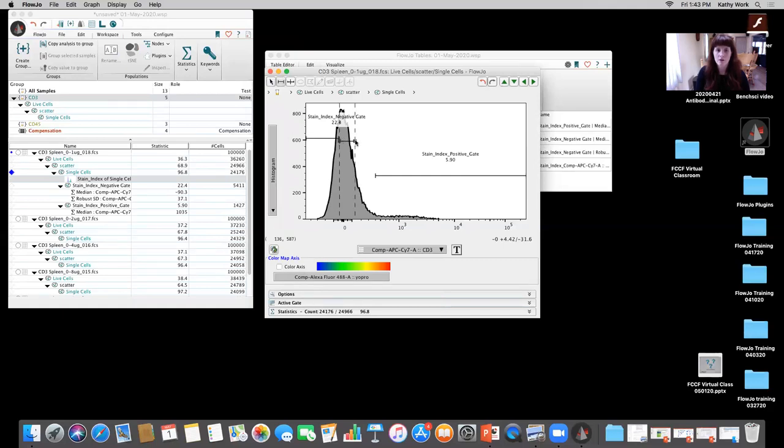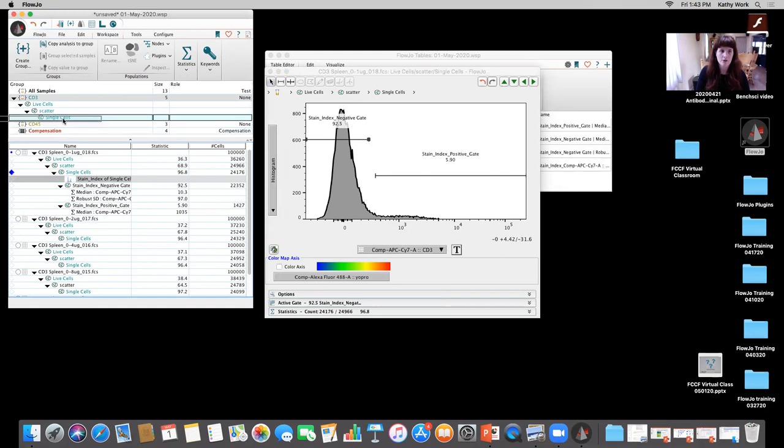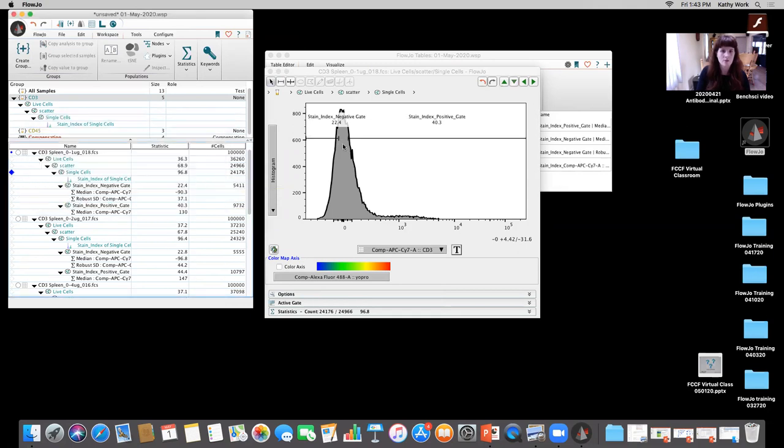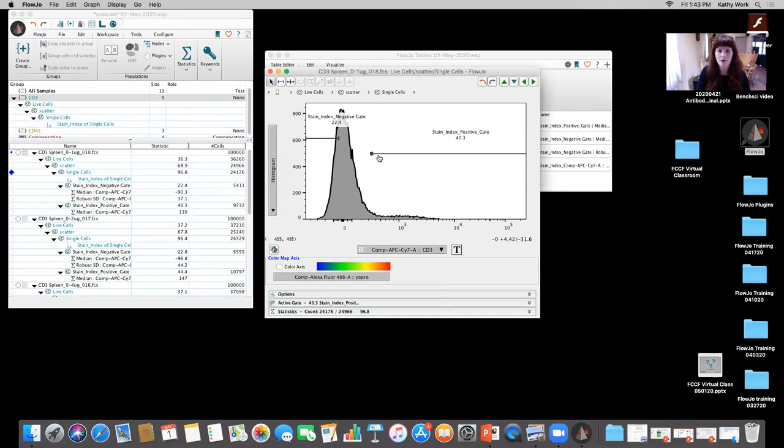So I'm going to come in here. Oops, I'm just trying to adjust that one gate. And now I have my positive and negative gating all squared away. I'm going to take this stain index analysis and I'm going to drag it up to all single cells. Okay, we're going to hit yes that we want to replace. Oop. Now it made it all the same, because I hit yes to replace that node.